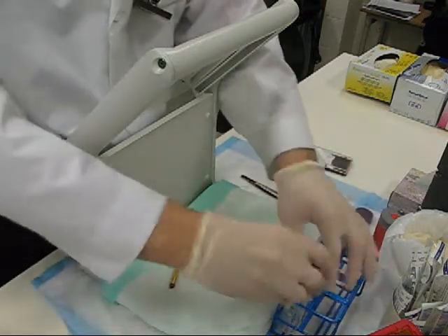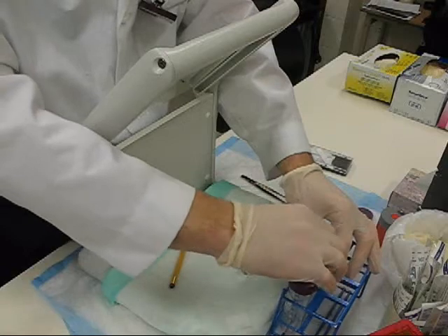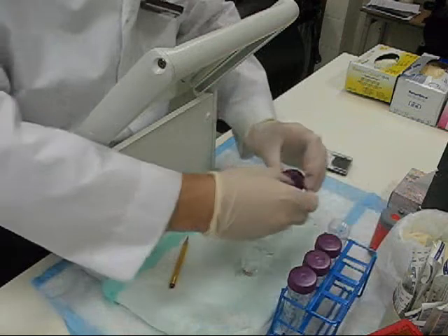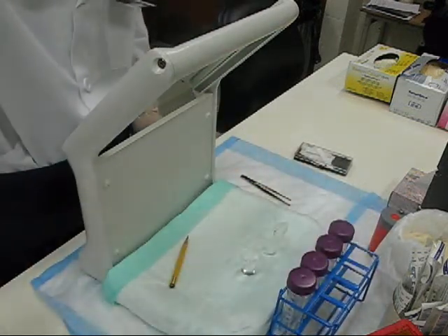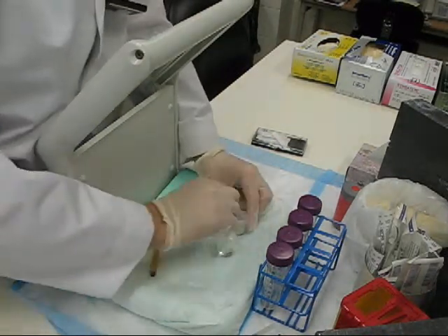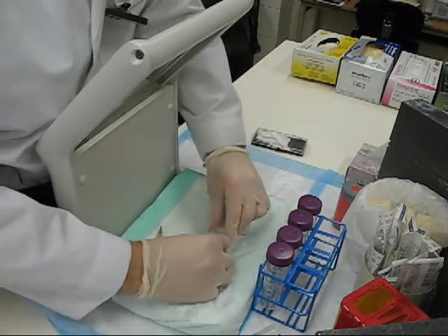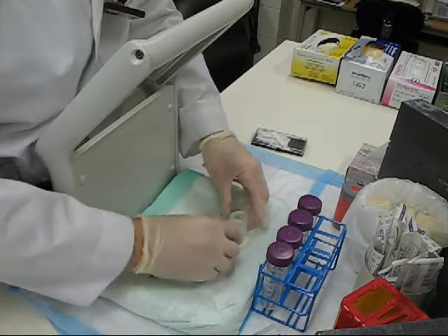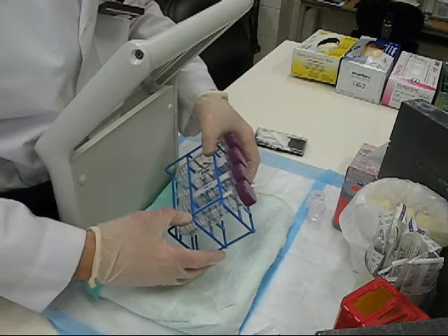When this is completed, quickly put on the tops of each container and you're ready to count. Be sure to cover up your mobile phases again, because the MEK is very volatile and it makes the lab quite stinky. Set them aside and take your tubes to count in the MCA.